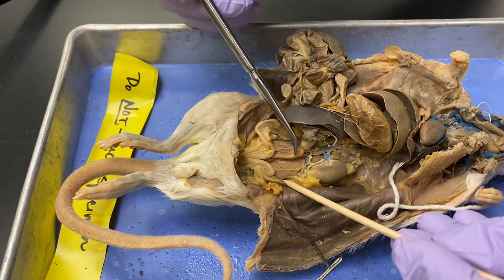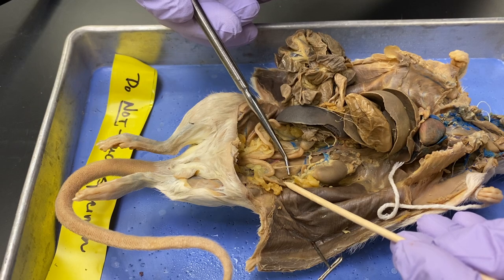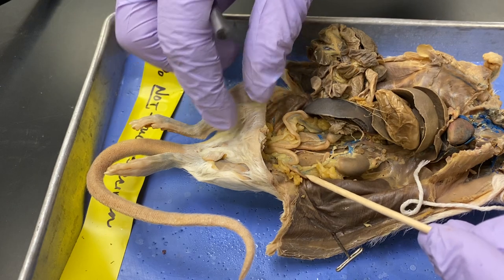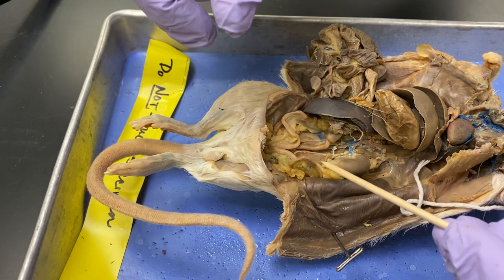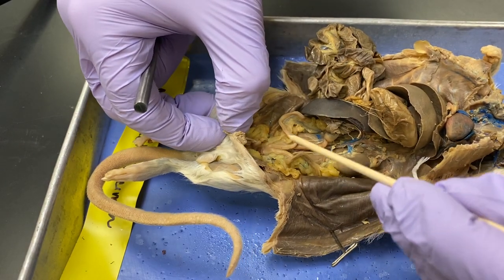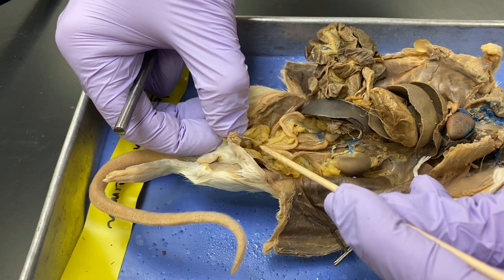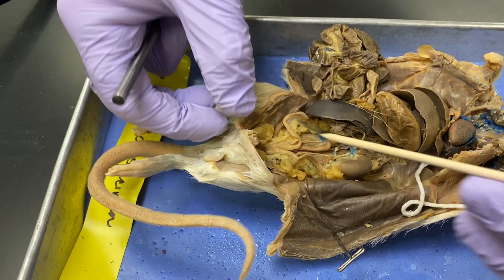So now we see kidney, ureters right there — a really nice one — and then disappearing back here behind the uterine horns or oviducts. We'll peel back this abdominal body wall and way down in here again you can see that little thing — that's the bladder again.